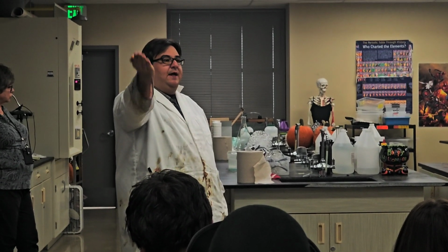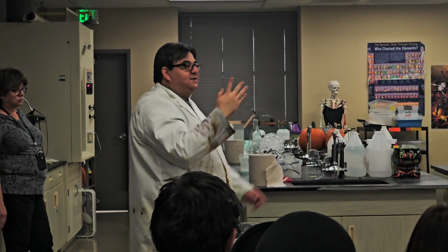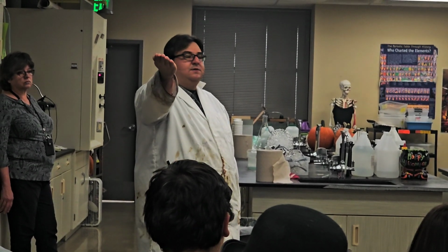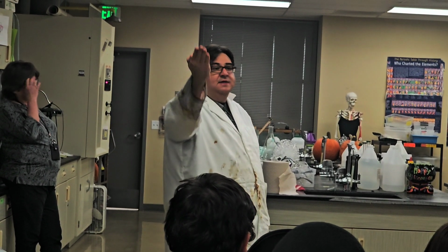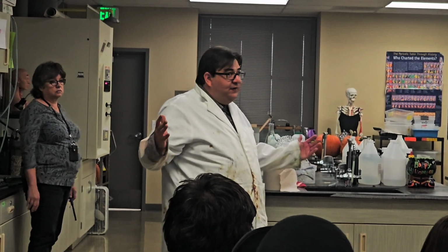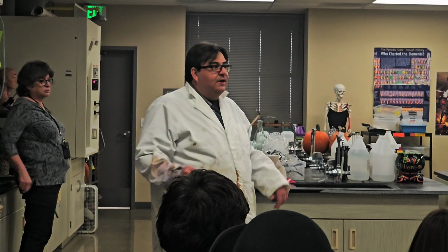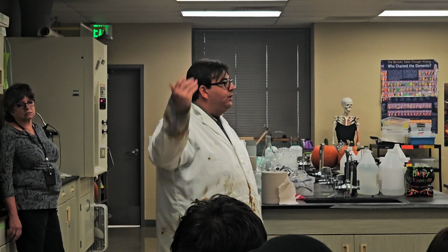So you will want to make sure you're out. The other thing is make sure your fingers are nice and closed tight together. This stops you from getting any burns in between your fingers. Okay, so nice and tight, close together, and out, okay? And then Miss Basil's going to hold your wrist, because for some reason, everybody, when this happens, it's fire, it's going to be hot. This isn't fake fire, it's real fire, okay? Is that you're here, and then all of a sudden it's like, fireball, ah! Okay? And you pull your arm down.